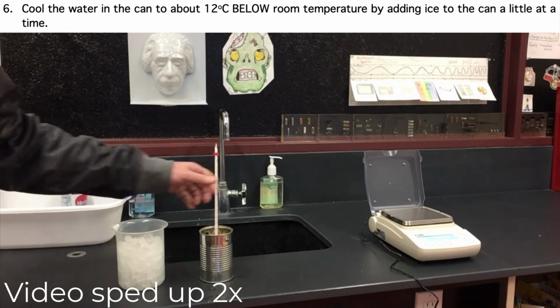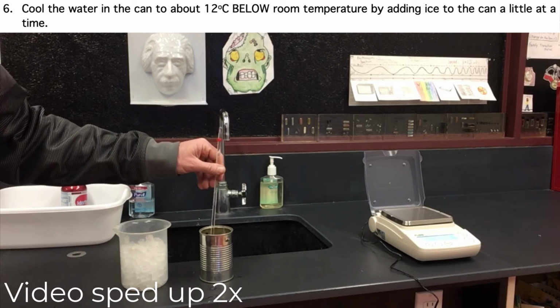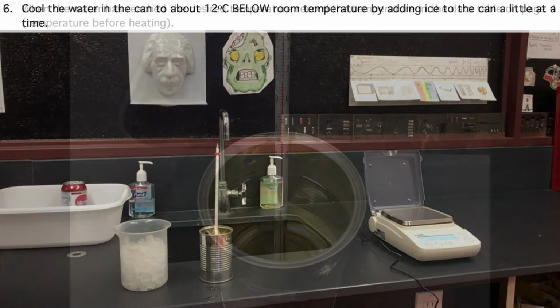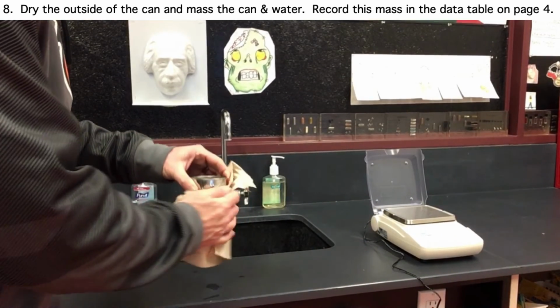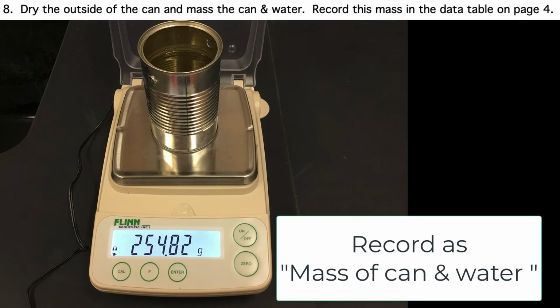To do this, we will add a little ice. Once we have it cooled down, we want to record the temperature in the data table. Make sure 6.5 degrees goes in your data table on page 4. Now we want to remass the can with the water. We're going to dry the outside off really well, and then record this mass in your data table on page 4. This is the can plus water.